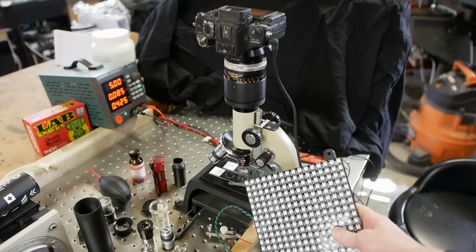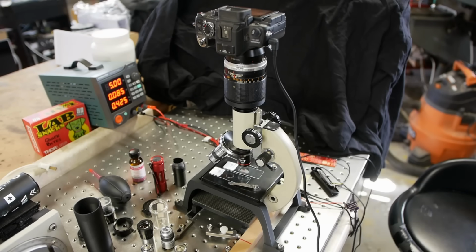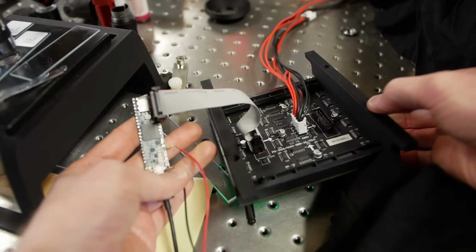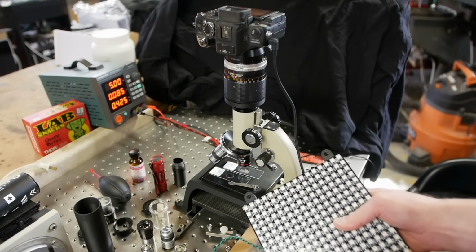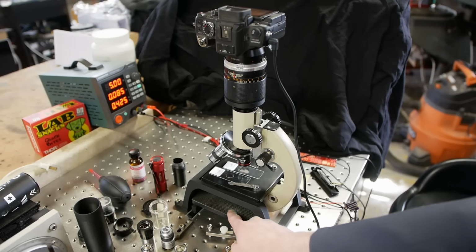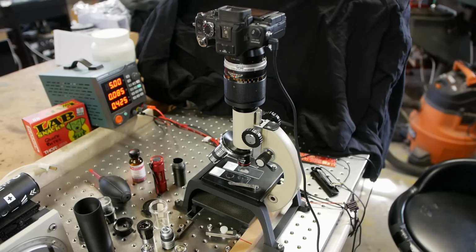So I originally tried making it work with this larger 2812 array of LEDs, and this does not work because these LEDs are just physically too large. So I ended up using a so-called Hub 75 LED array, and these are really small LEDs with no smarts in them. So it's basically just a bunch of shift registers as opposed to an LED matrix like this where each LED has a processor inside it. I'm using a pitch of 2 millimeters, but really the ideal pitch for this setup is about 4 millimeters. So I'm just using every other LED.